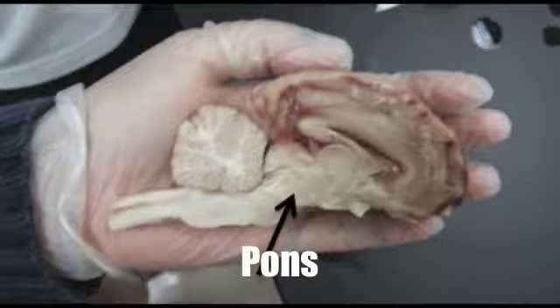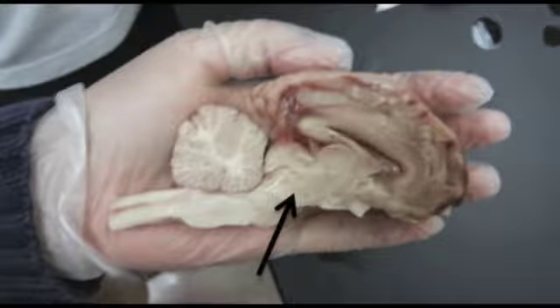The pons connects the upper and lower brain together. Its primary function is to relay messages from the cortex and the cerebellum. Without the pons, the brain couldn't transmit or pass along messages. Dreaming has been proven to originate in the pons.